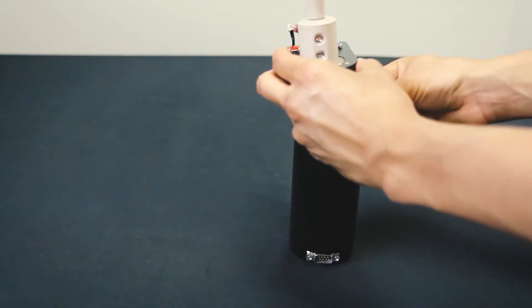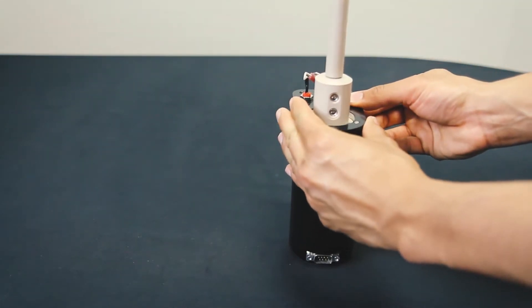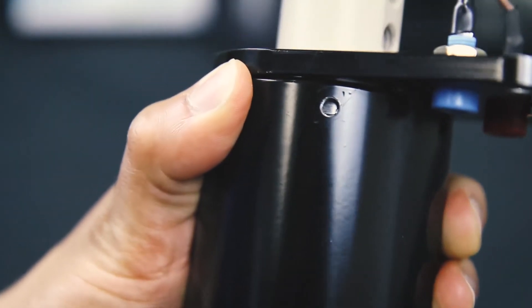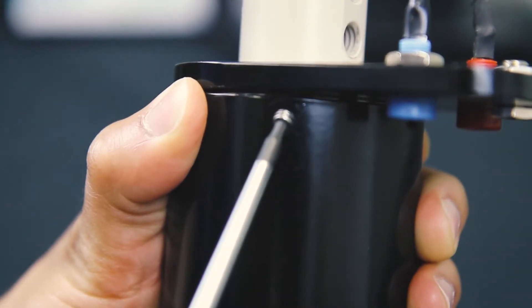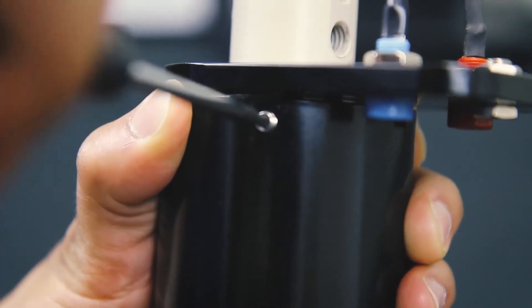Place the motor unit back on the table with the shaft pointed up. Using your 3-32nds of an inch hex driver, thread the set screw into the motor housing.